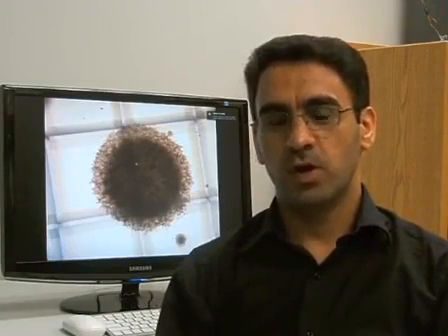Using the neurosphere assay to determine the frequency of bona fide neural stem cells in a mixed neural cell population overestimates the number of neural stem cells, because there is not a one-to-one relationship between neurosphere formation and neural stem cells. We developed the neural colony-forming cell assay in our lab to overcome this limitation.